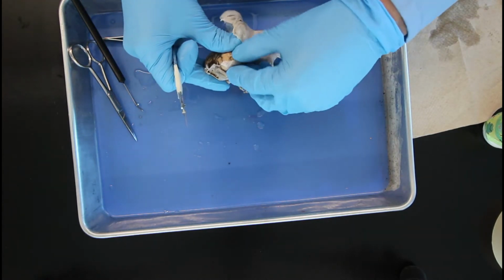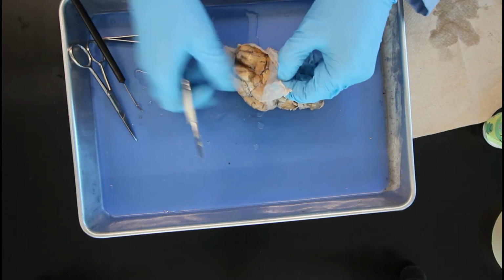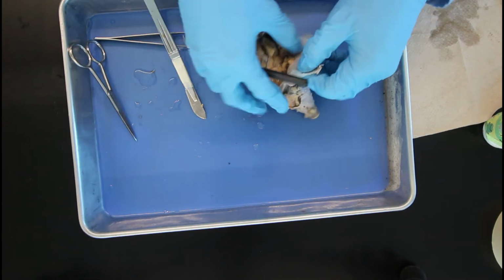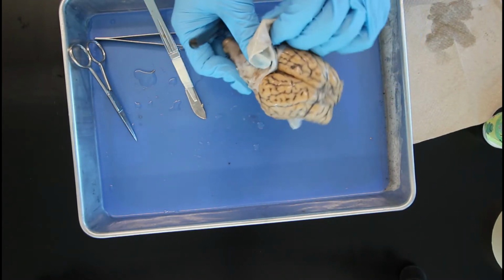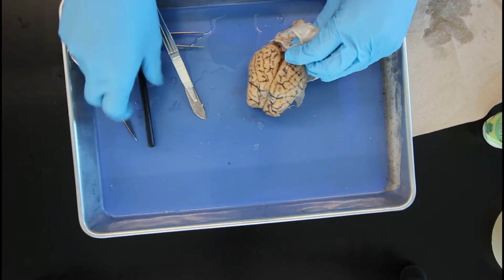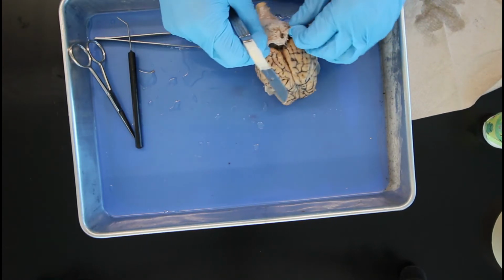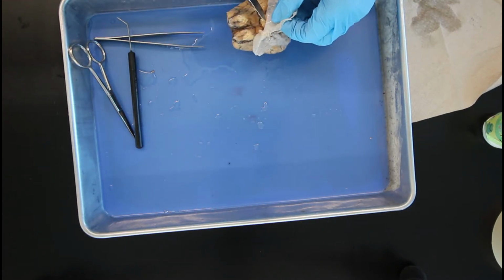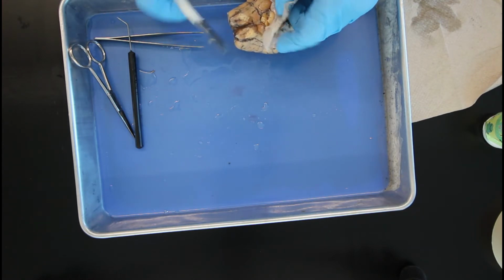The arachnoid mater is the middle layer of the meninges, laying directly below the dura mater, and this contains a lot of connective tissue and is avascular. Underneath the arachnoid mater, there's a little bit of a pocket. This is known as the subarachnoid space, and this is where the cerebrospinal fluid is, and this basically acts as a cushion for your brain. So if you ever get a head injury, you have a little bit of a cushion to help protect your brain from being damaged even further.